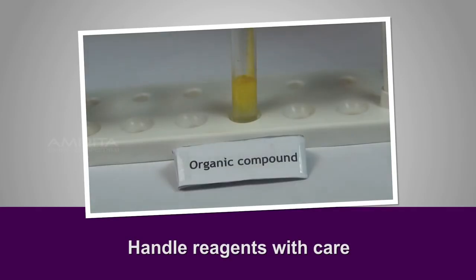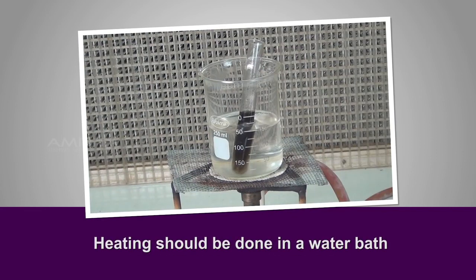Precautions: handle reagents with care. Heating should be done in a water bath.